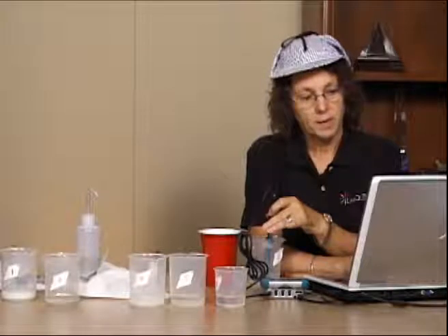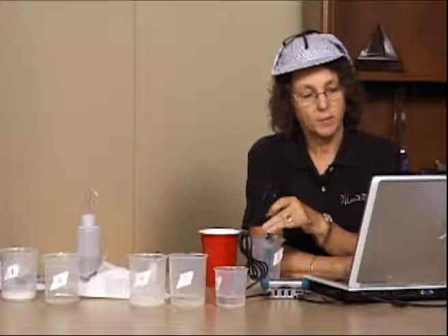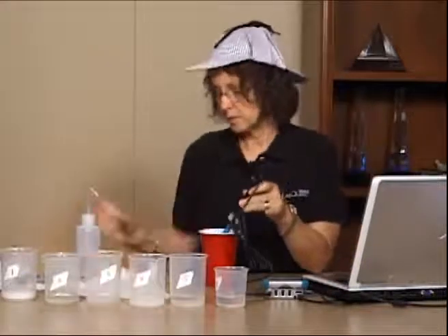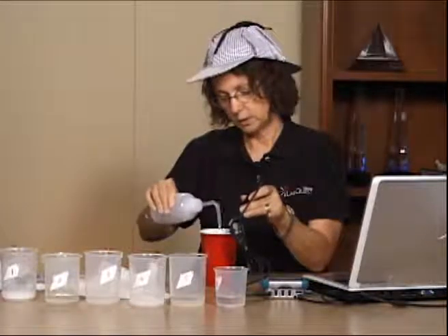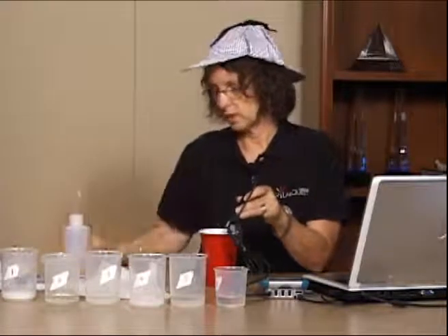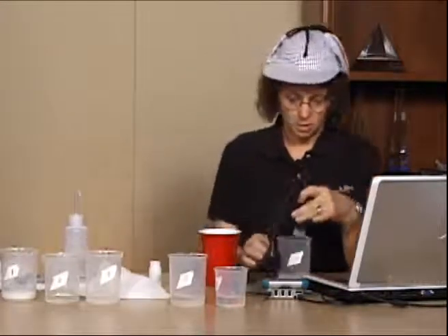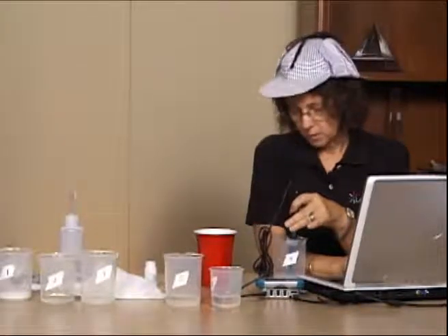One of the things I found in my classroom is I sometimes, instead of doing it like this and having everybody have all of the probes, I will set up stations, and the students will have stations where they're looking at solubility, stations where they're looking at the crystals, a different station where they're measuring pH. And that allows me to have fewer probes out if I don't have quite as many probes as I do groups. It also tends to give everybody a job to do so that I can make sure that all of the students are involved.